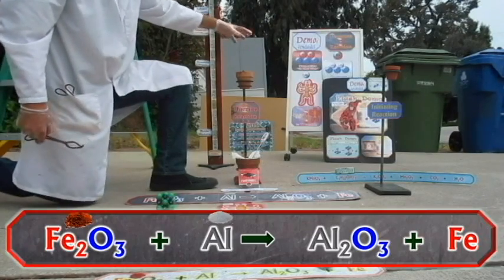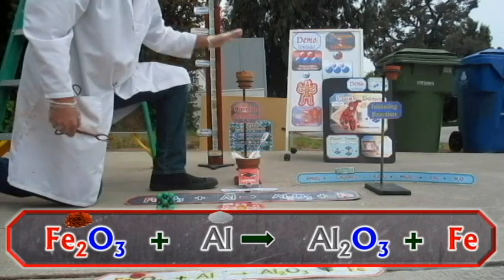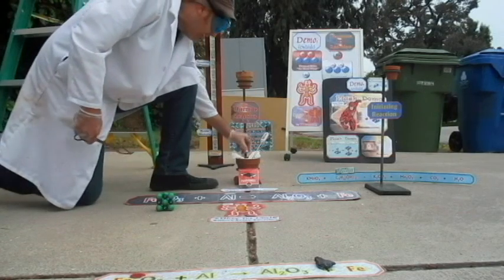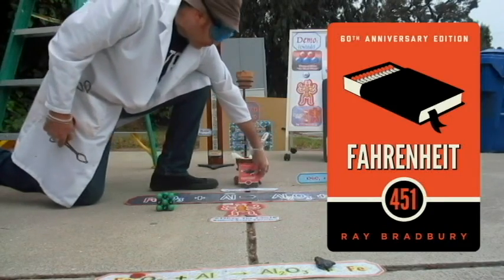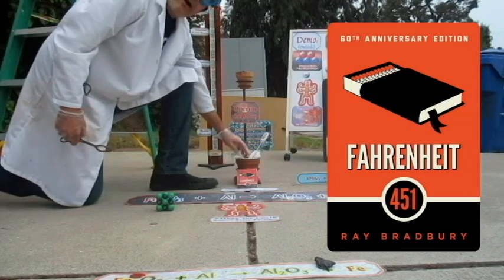Then the thermite's going to get going. Like lava, hotter than any lava on Earth or Mars or Venus or anywhere. It's going to pour out onto the one ring to rule them all, and onto the ionic compound, and onto the cellulose, Fahrenheit 451. So what we're going to see is, these are 3 ways of measuring how hot it gets.